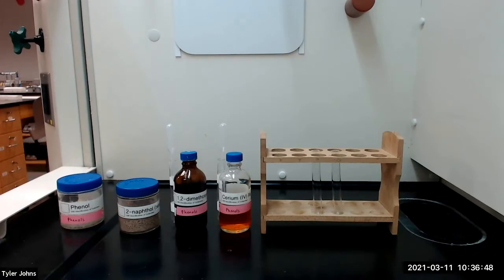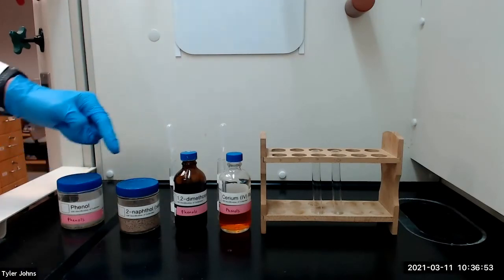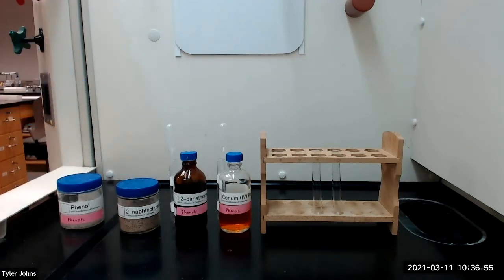We will now perform the cerium-4 test for phenols using the test compounds phenol and 2-naphthol. The cerium-4 test provides a more reliable way of detecting the presence of the hydroxyl group in water-insoluble phenols than the ferric chloride test.